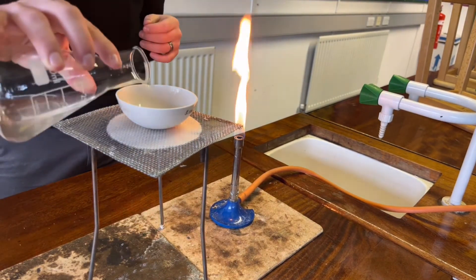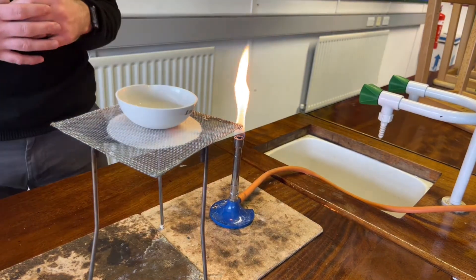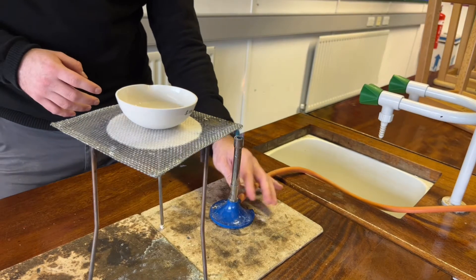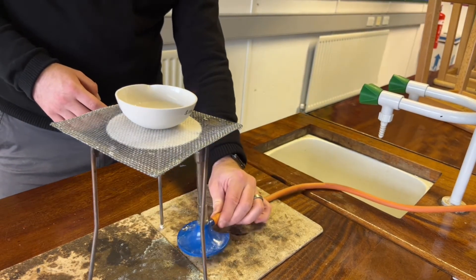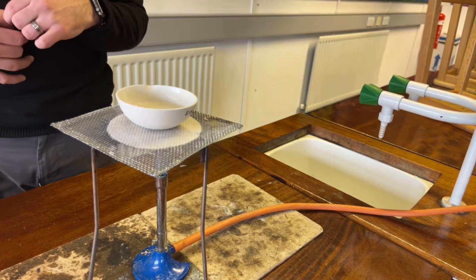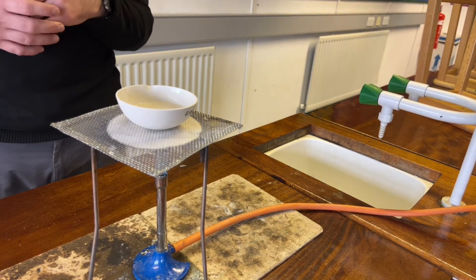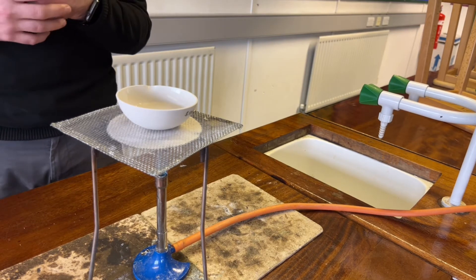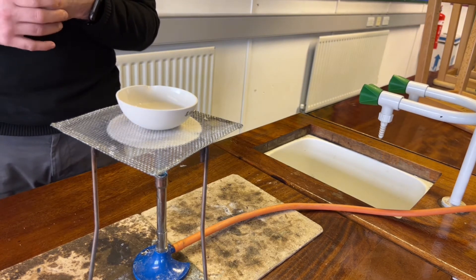Put a small, half-filled amount of the solution in, put the Bunsen half open so we heat gently, and put it underneath the evaporating basin and allow that to boil gently, in order for the water to evaporate — to go from the liquid phase into the gaseous phase — and leave us with the solid solute.